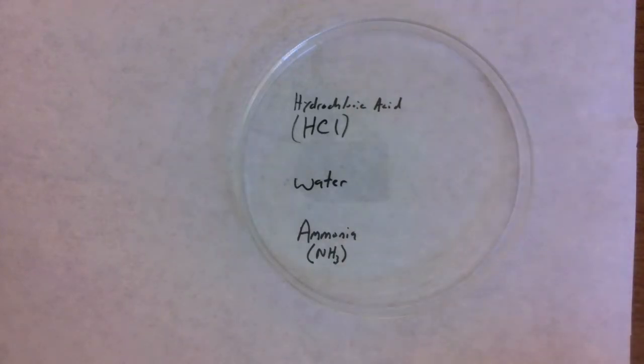In this lab, we're going to be investigating how acid rain affects different lakes, primarily based on the bedrock that is in those lakes. And of course, acid rain, we've learned, is caused by multiple sources: sulfur dioxide, which is released when we burn coal, and different nitrogen oxide compounds that are often released whenever we burn fuel, like in combustion engines for cars. And so in this lab, there's a few chemicals we're going to be working with.